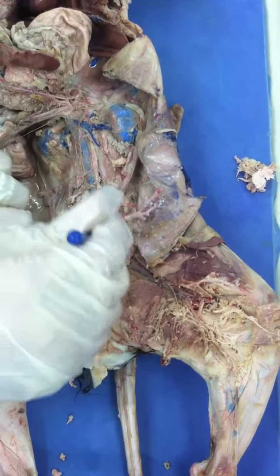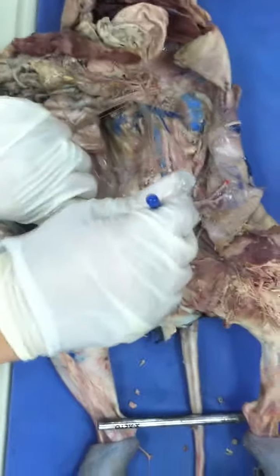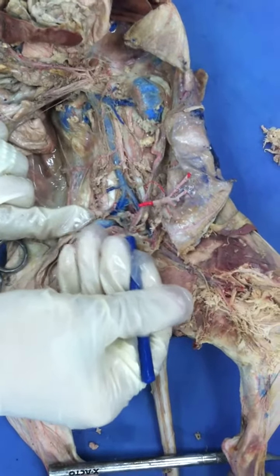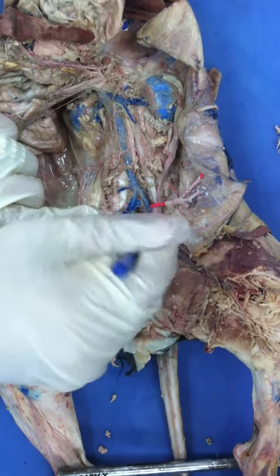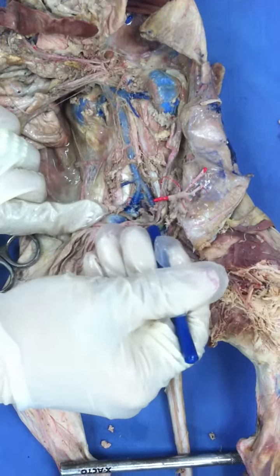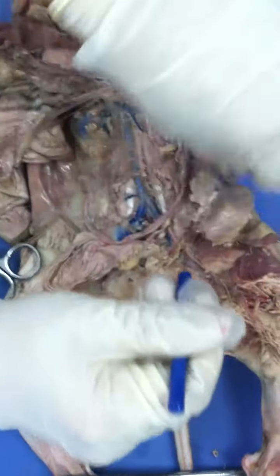On the inside, if we continue dissecting, we're going to see very small caliber blood vessels, which we call the internal iliacs. This is the left one. I'm sorry, the right one. And then the left, it went to a better place. Oh, no, here we go. See, a little bit. You see? Okay. Now, we continue our journey.